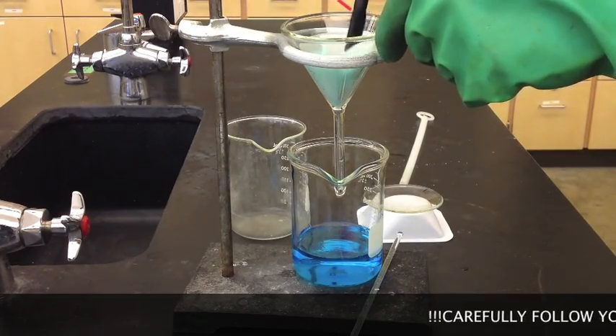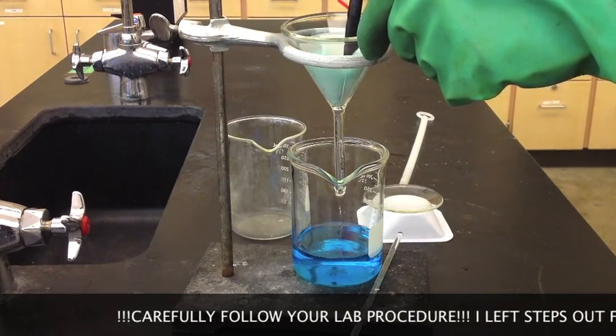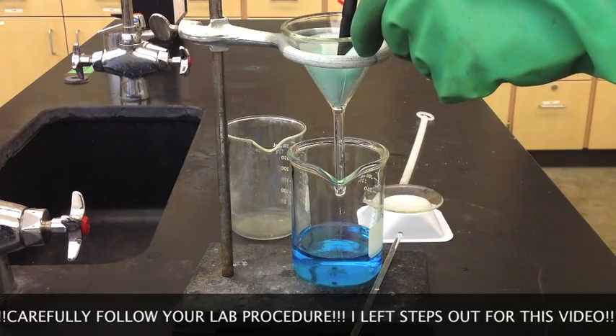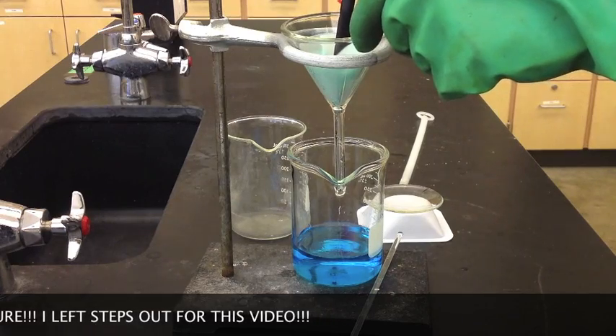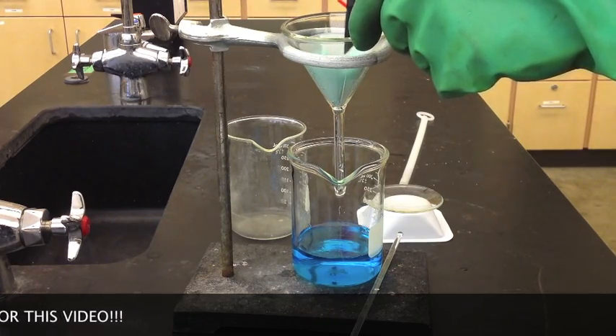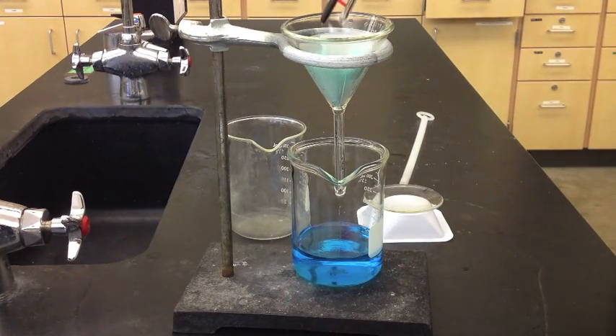You need to be careful because you're supposed to wash the filter off with ethanol — that helps dry the material and get rid of the water. I'm using the rubber policeman to pick the side of the filter paper off from the funnel wall. It'll take some time to find a loose spot. Once you get it pulled loose, you can keep it from sticking back on by putting the glass stir rod between it and the filter, then just peel it away, working methodically all the way around the side.